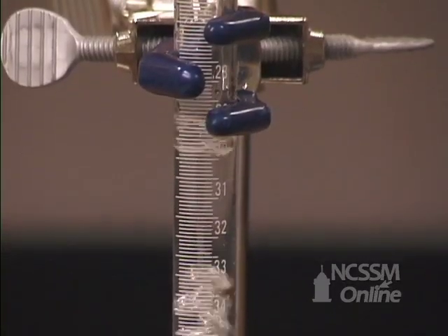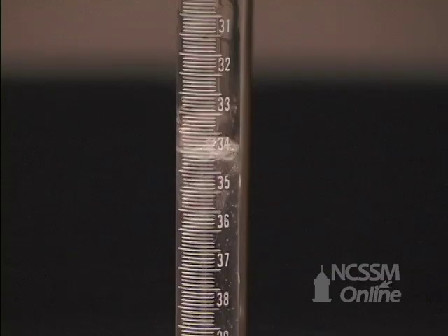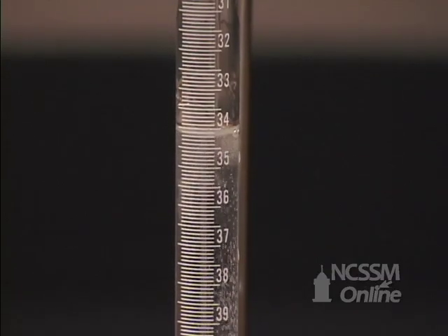After the magnesium has completely reacted, we will let the hydrogen gas stand for a few minutes, so that it reaches the same temperature as the surrounding air.